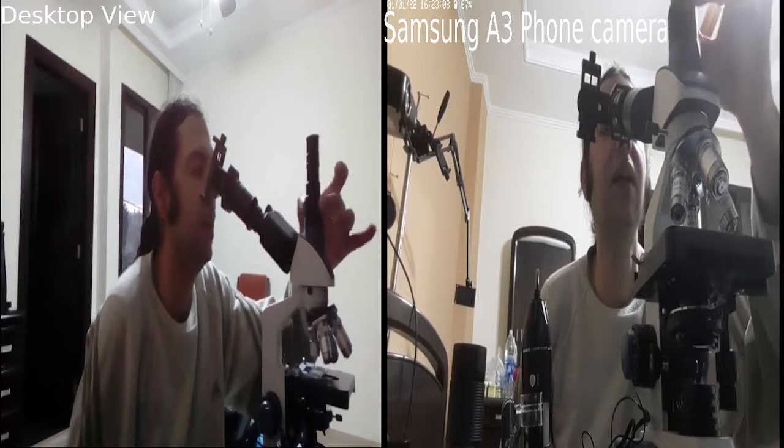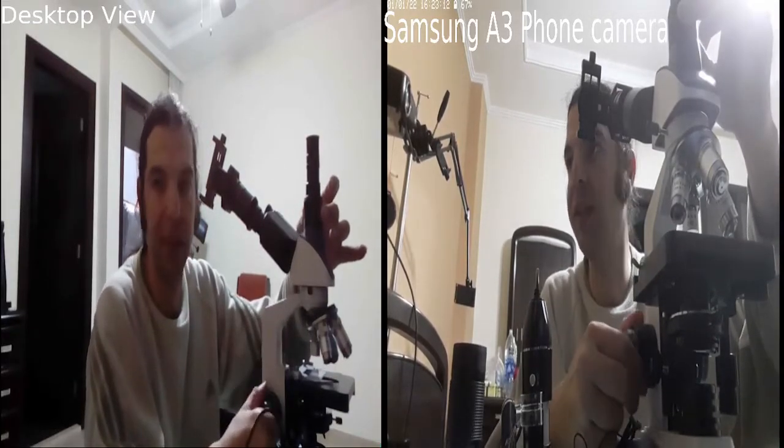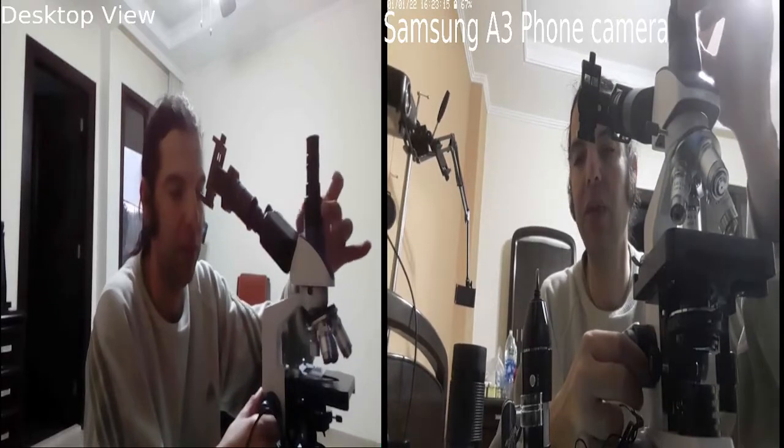And don't worry about the focusing. The stage will move up and down, so don't worry about the focusing. There you have plenty of space to focus.